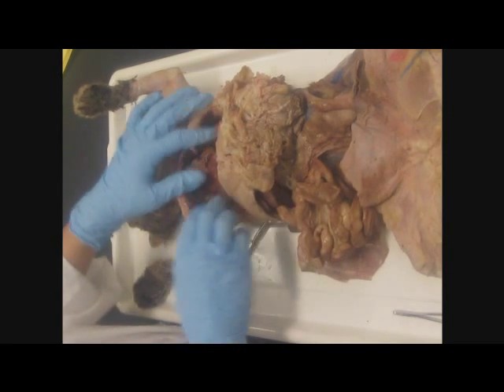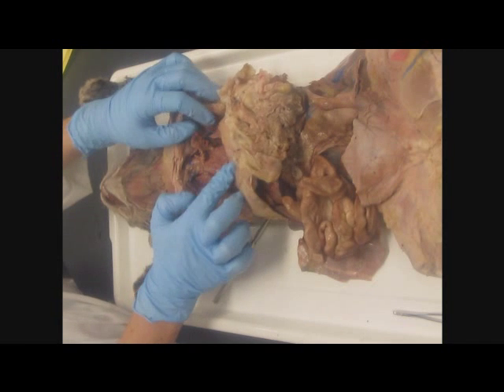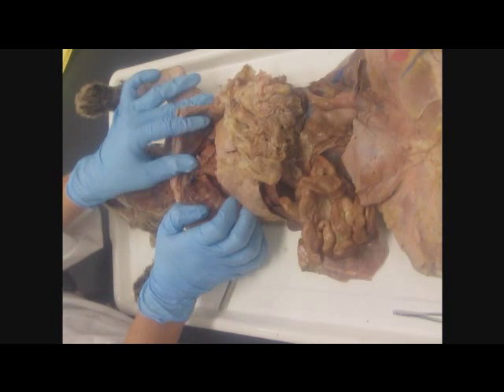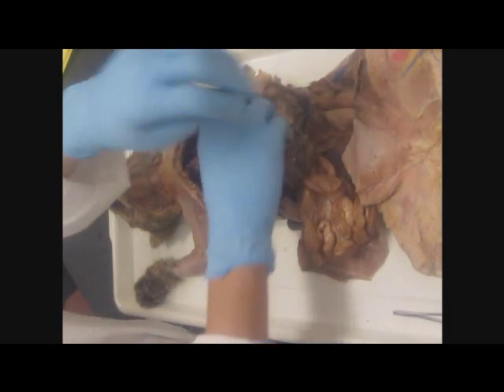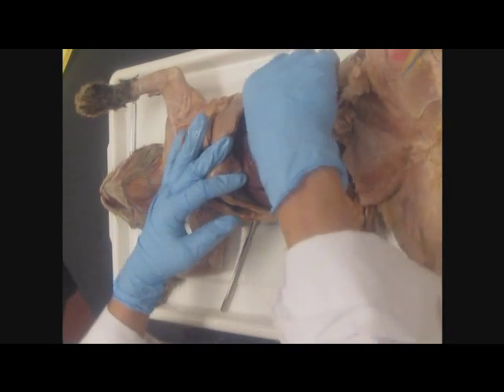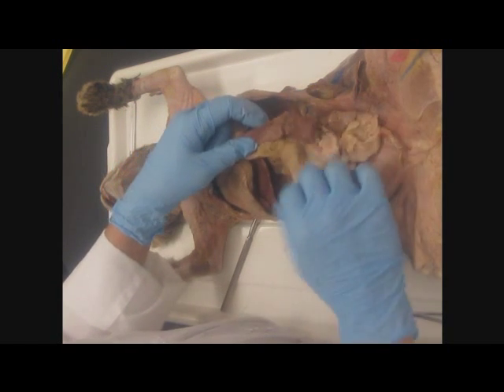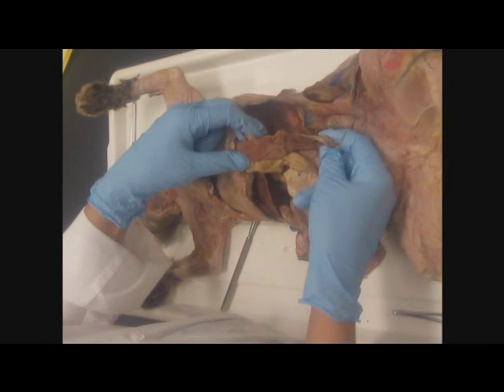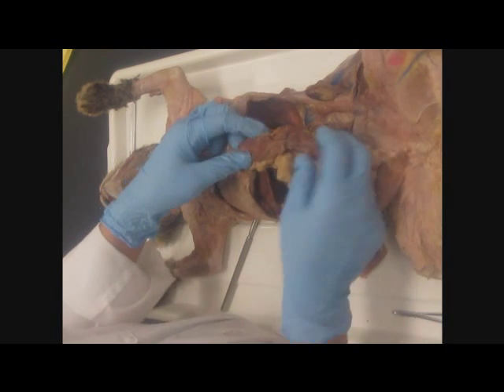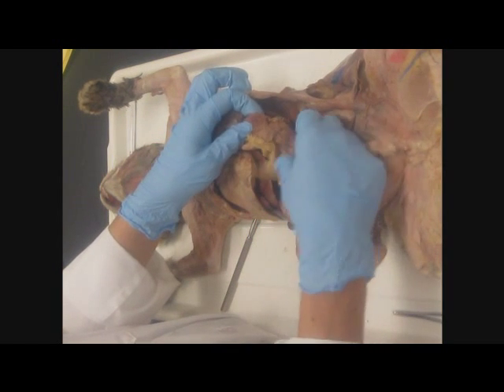Alright, major organs, I already showed you the heart, that's in there. Right and left lungs on either side of the heart, right lung, left lung. And then we have the liver, it's the large brown organ, and the stomach. The spleen is right next to the stomach, so it's on the left side, left quadrant. And it's this elongated brown organ, like this. It's a little bit longer than it is in humans. Humans were a little more oval. Cat spleen is long, but in the same position and serves the same function.